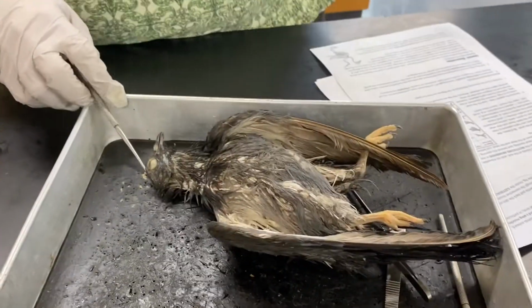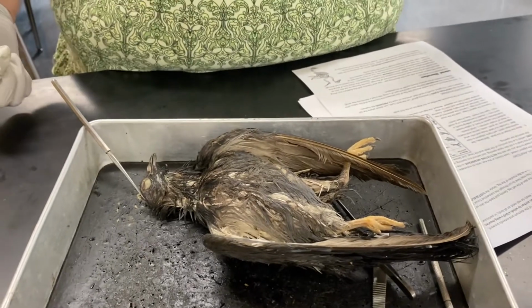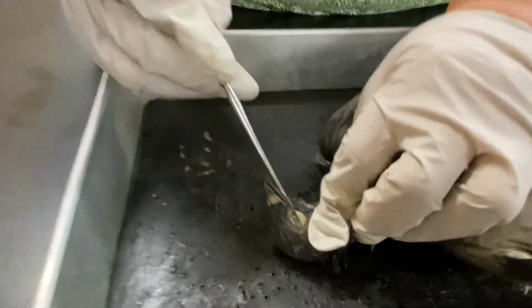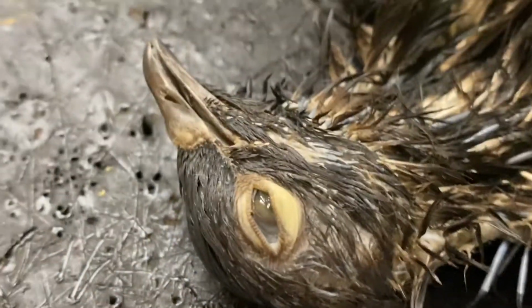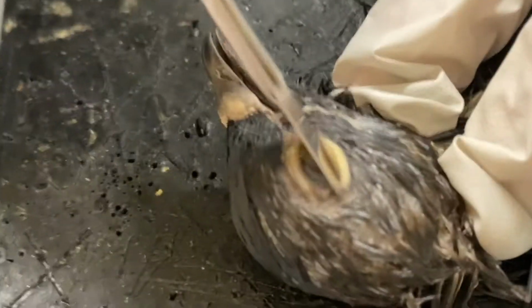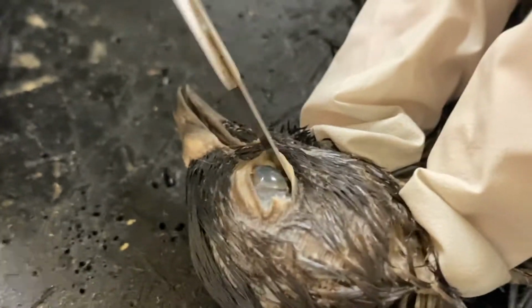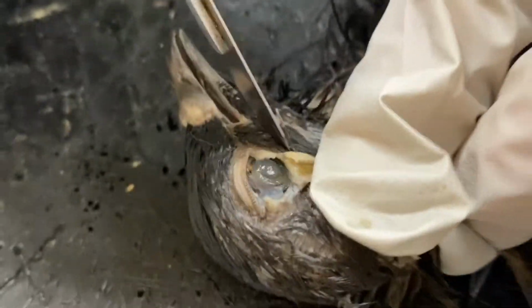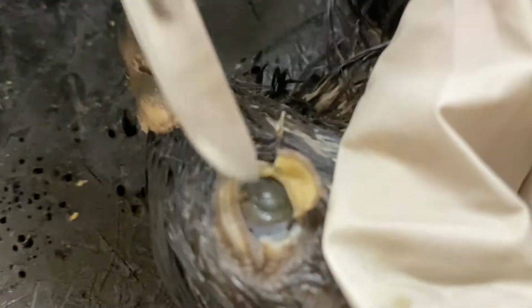Now, once we get into it, depending on how recently this one ate, we might be able to see some of its food. Let's take a look when we peel back the eye. The nictitating membrane, you can see that it has a lot of the same features. Let me actually cut off the nictitating membrane a bit. How many minutes are we on? 5. Okay. Cut off the eye. Caitlin, if you get in there real close, you can see the iris of the eye.